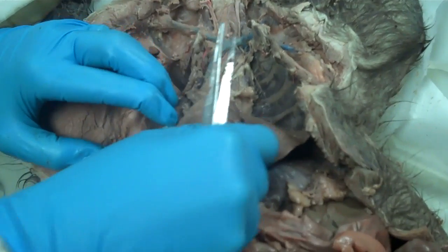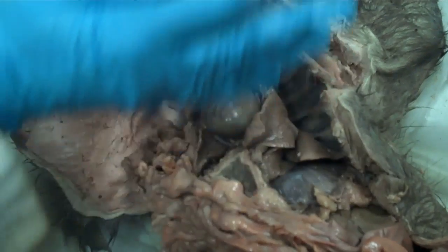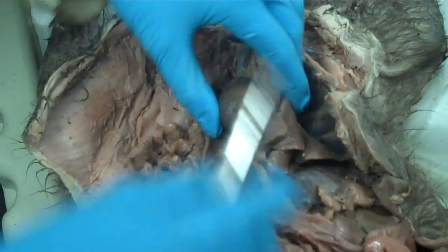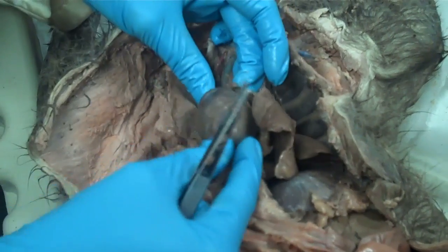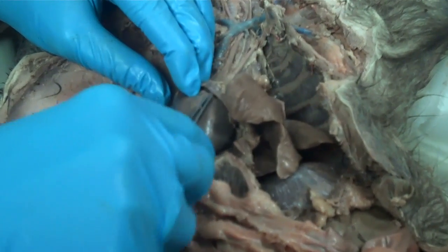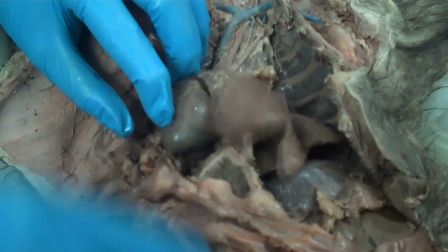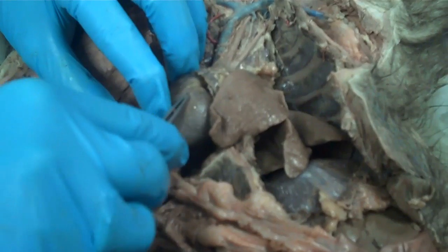We are going to go over the arteries and veins in the upper part of the cat. This is your heart. On the surface of the heart are your coronaries — these little pink vessels here.